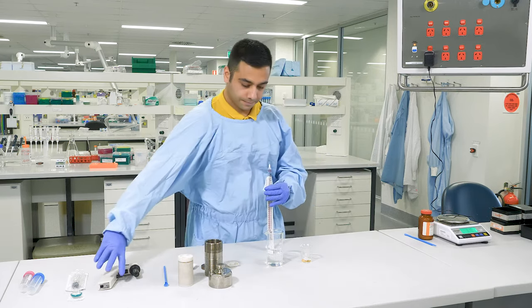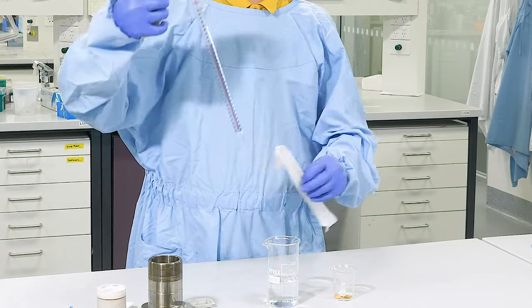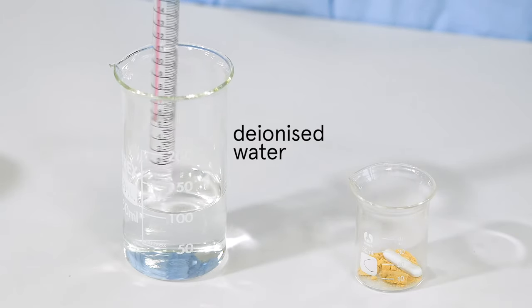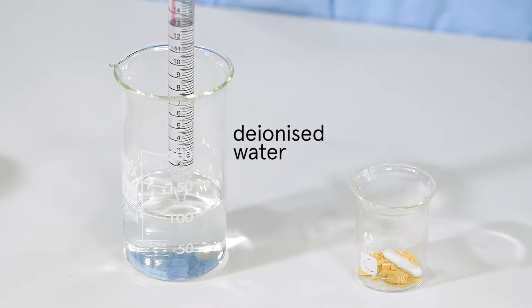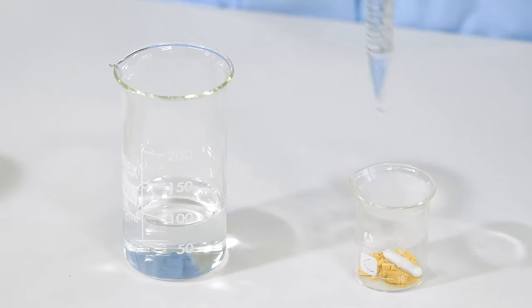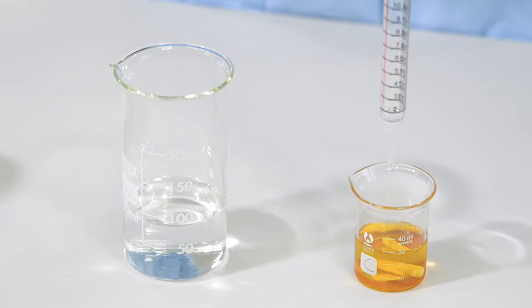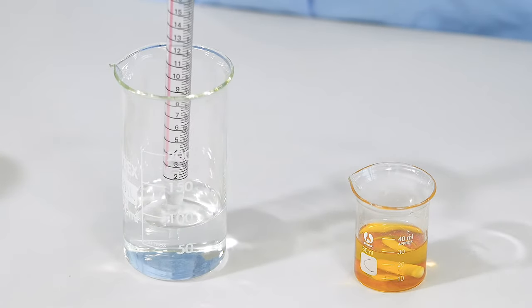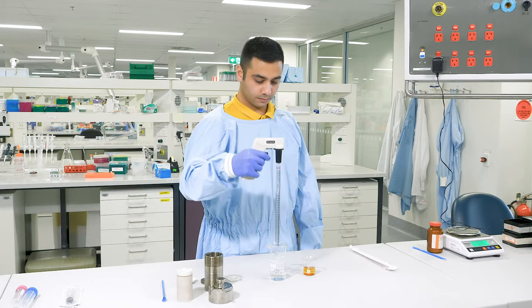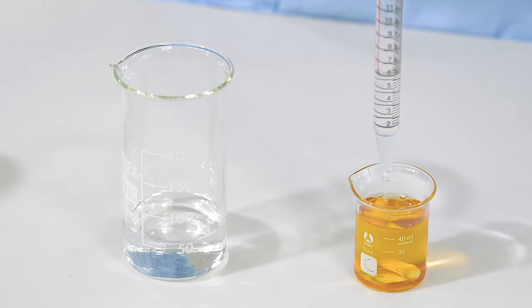I will open the glass pipette packaging at the tip and insert that into the base of the pipette controller. Now, I remove the packaging and go ahead and suck up 25 milliliter of deionized water. I dispense that into the beaker that has our powder. This pipette is 25 milliliter but we need 50 milliliter so we need to do it two times. Using deionized water is important because we don't want any unwanted ions such as magnesium which can be found in tap water incorporating into our carbon dots. These ions would change the properties of the carbon dots and we don't want that happening unintentionally.